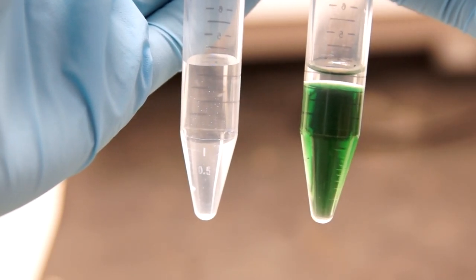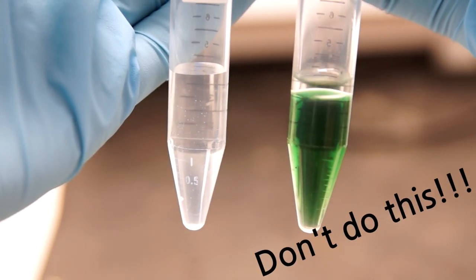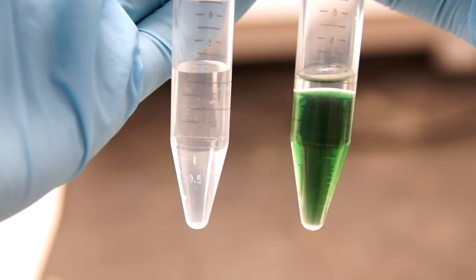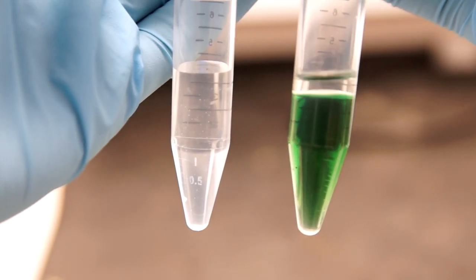Here's an example of what not to do. On the right, there is an aqueous layer with some organic on top. You want to try and separate the layers as much as possible and not bring organic along with the aqueous layer.